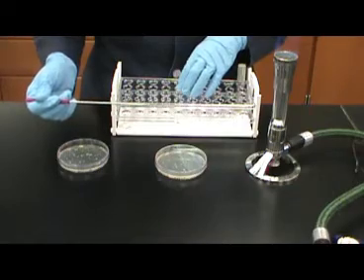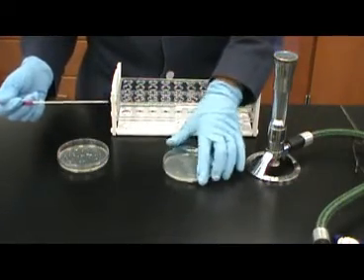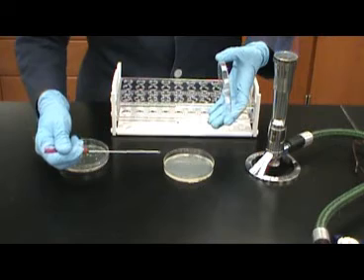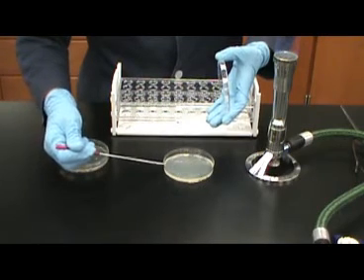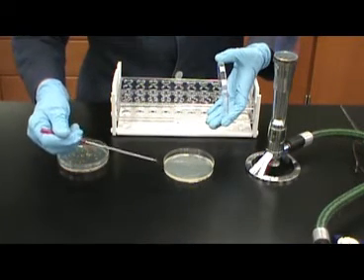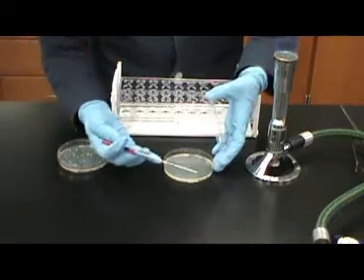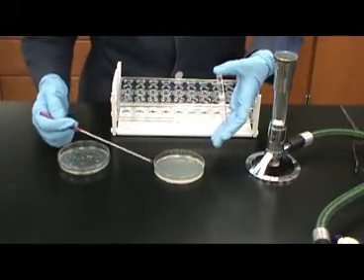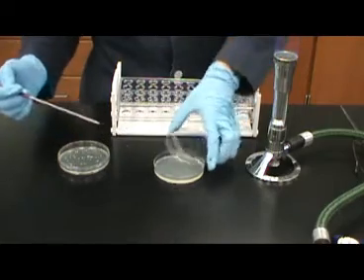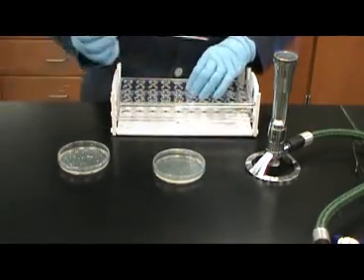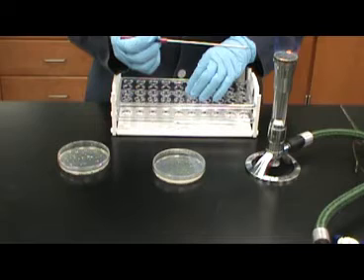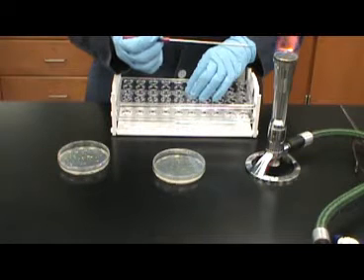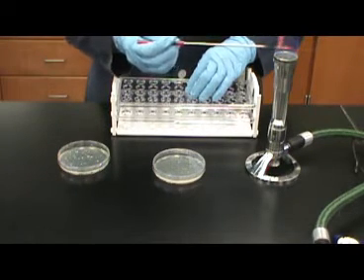After allowing the loop to cool, place the now sterile loop in the center of what you just inoculated. Drag over a small streak on the second third of the plate. Now using the loop, drag across the second inoculum and make the third. This should separate the bacteria from each other enough so that separate colonies can grow.